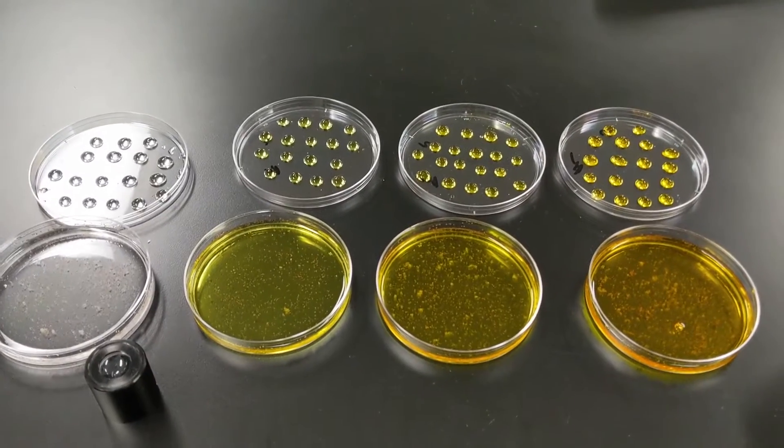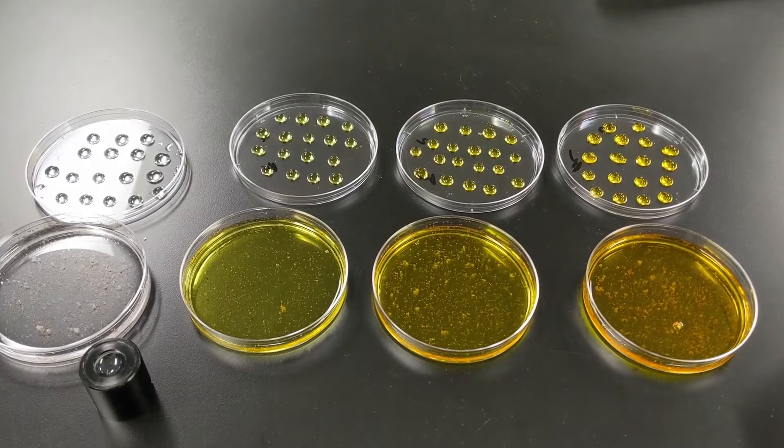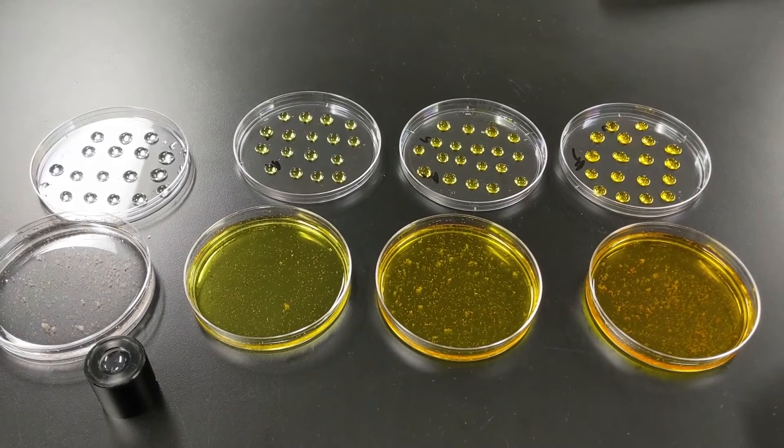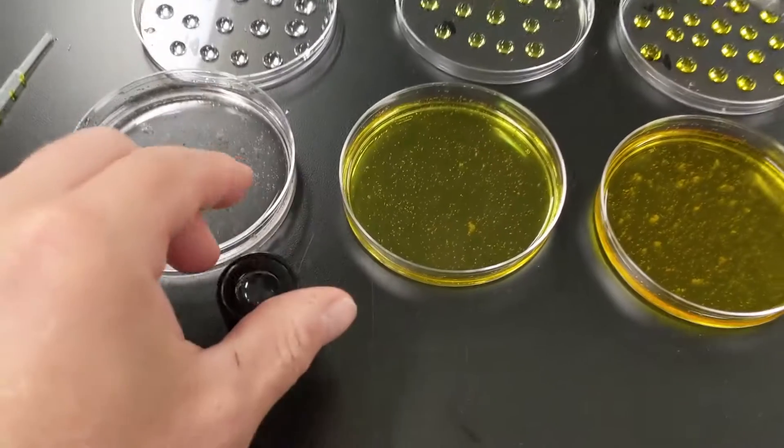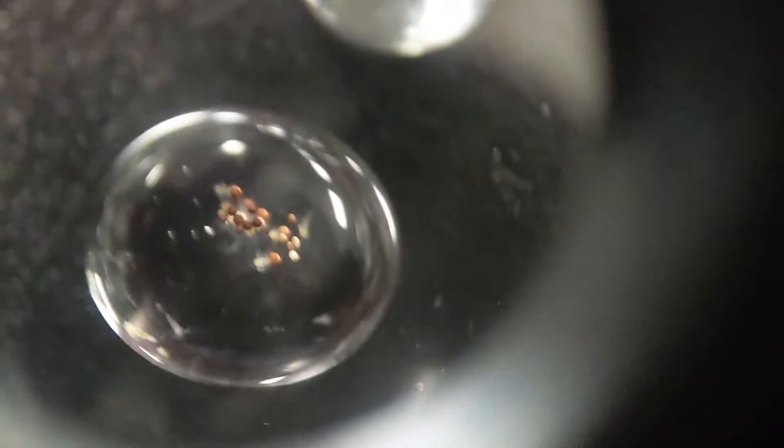Alright, so I have everything plated out here, and I have a good sample of each. I'm now going to try to get an average number of shrimp per drop. So I'm going to use my hand lens here, and we're actually going to go in and explore. See what we can find here. You can see them very well. There's one. Nobody's home there. One. One.